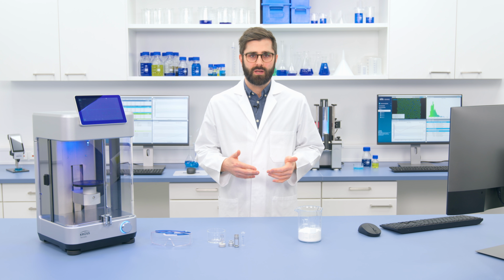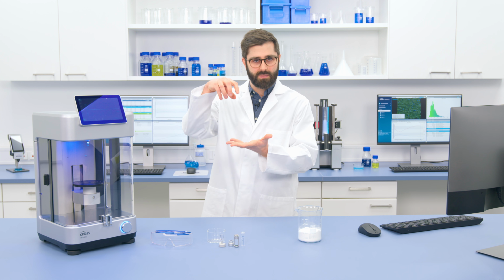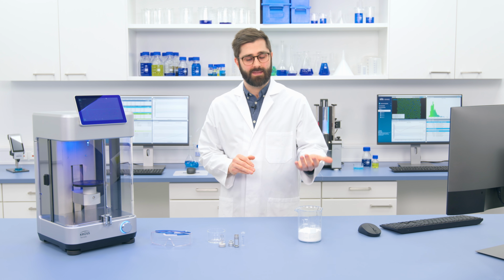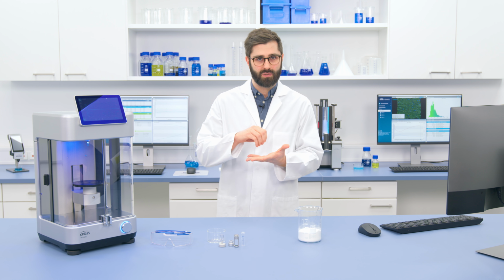Now we're going to take a look at how Tensíío can help us with these tricky samples using this Washburn Direct method. First of all, I should say the Washburn technique lets us measure contact angles even when a liquid is being absorbed into the material. In the case of powders, this can be particularly useful for assessing powder dispersibility. So for example, if you're putting pigments or additives into a solution and you need them to disperse well.